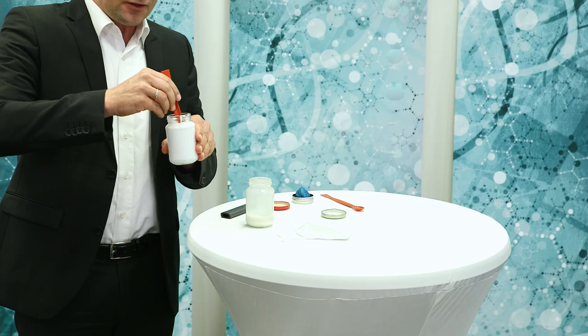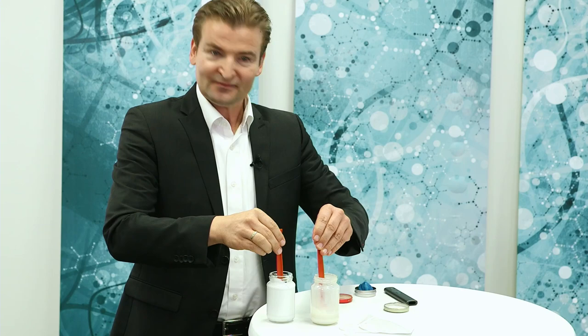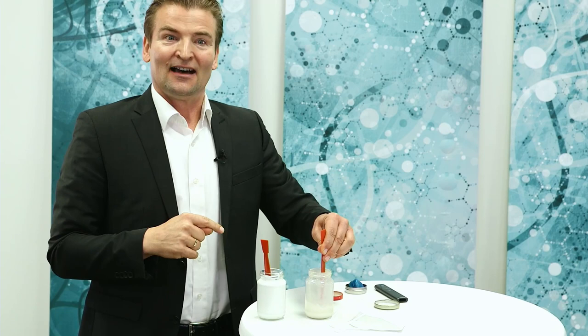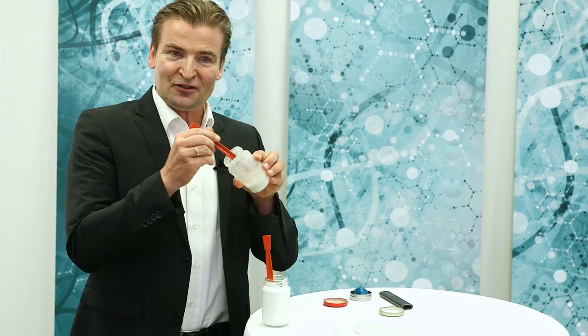These are two dispersions — one shear thinning and one shear thickening. If you take a spatula and dip it into either dispersion and pull it out slowly, both flow like honey at mid viscosity. But if you increase the shear rate by pulling the spatula out quickly, you see the difference: the shear thickening dispersion increases viscosity with speed, so the force is transferred to the beaker and it lifts up. The shear thinning dispersion reduces viscosity at high speed, so you can't lift the glass. You can imagine that if you try to process a shear thickening material, it will become impossible due to the high viscosity — in the worst case it turns from a liquid to a solid on the machine, giving no smooth film finish and a blocked die.